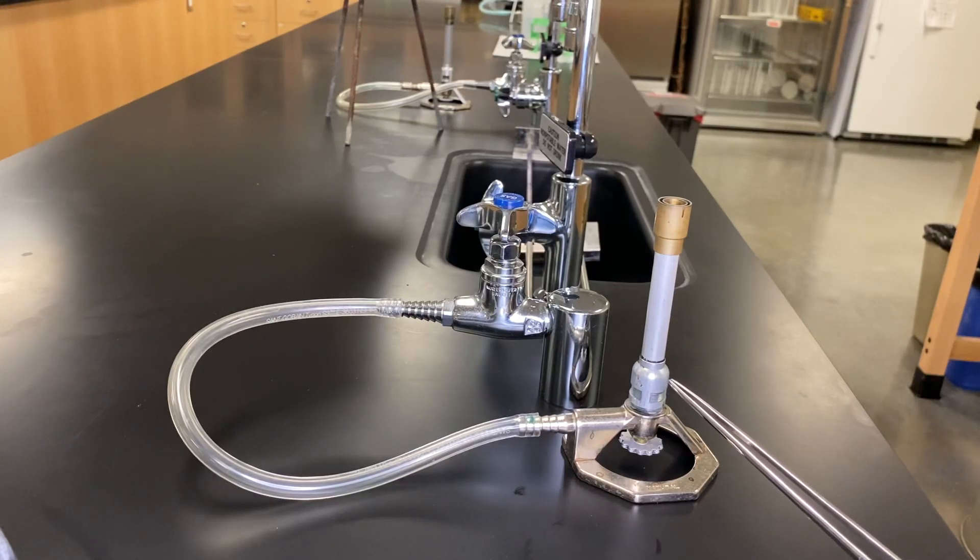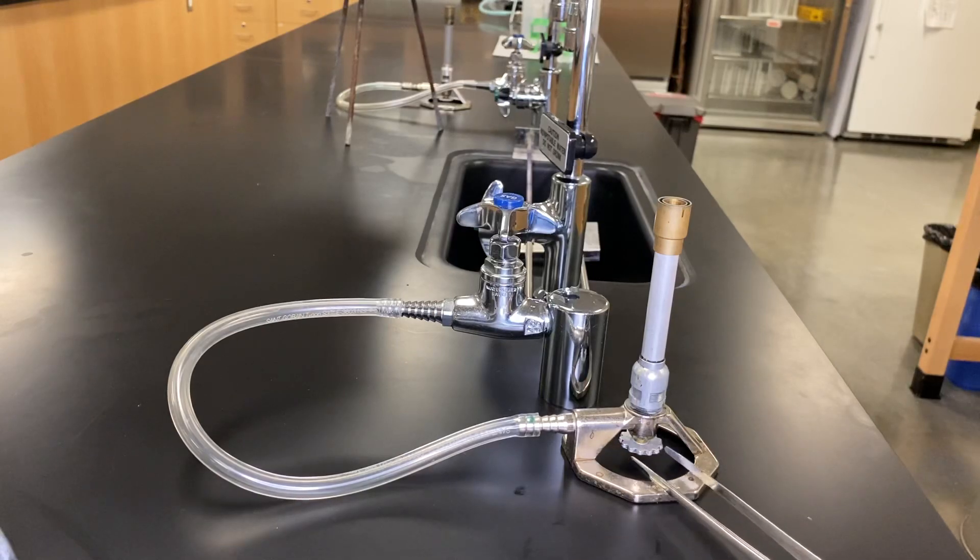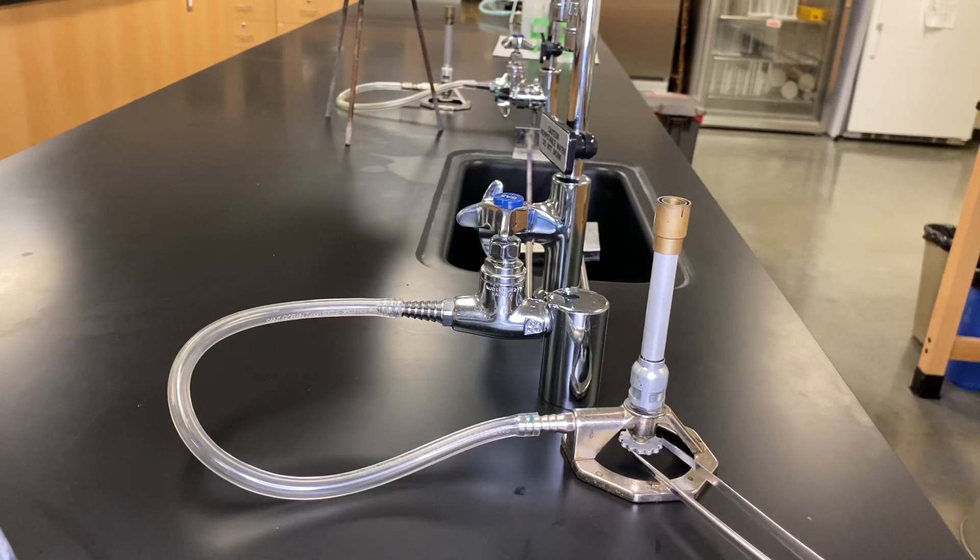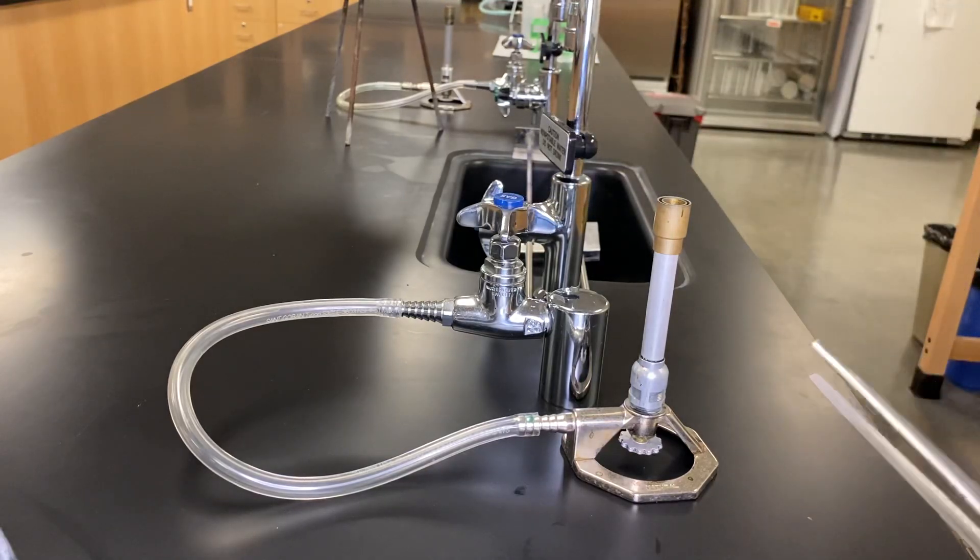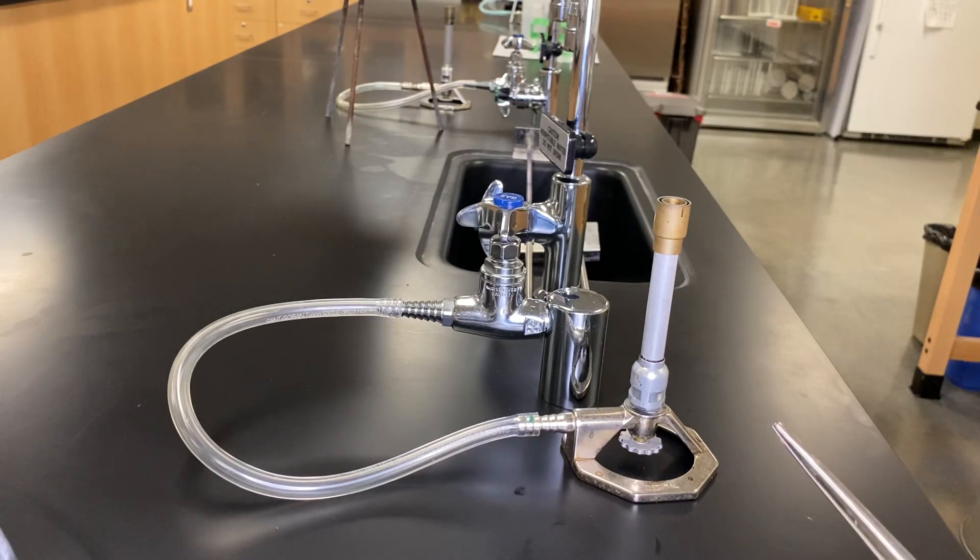Really what we're interested in is for any flame, more oxygen. And then ours happens to be a little bit unique, which has also a gas valve. This gas valve serves the same purpose as a normal valve, which allows us to adjust how much gas is going into the actual system.